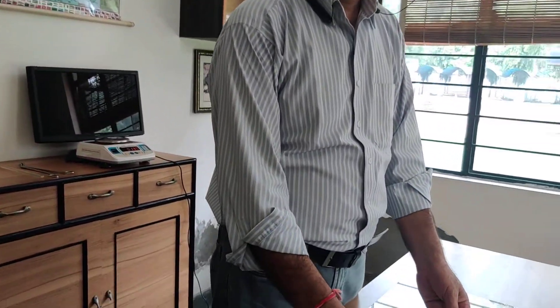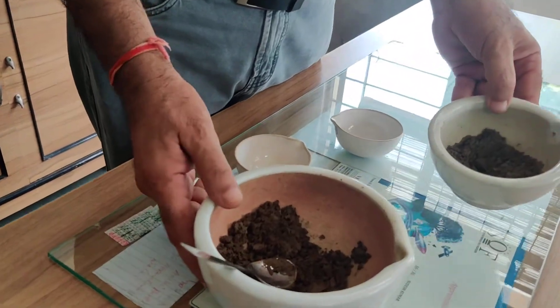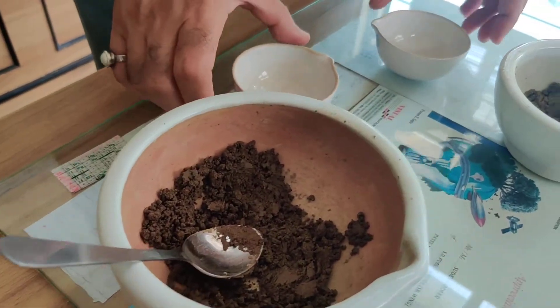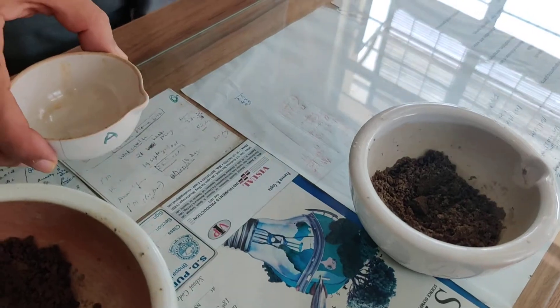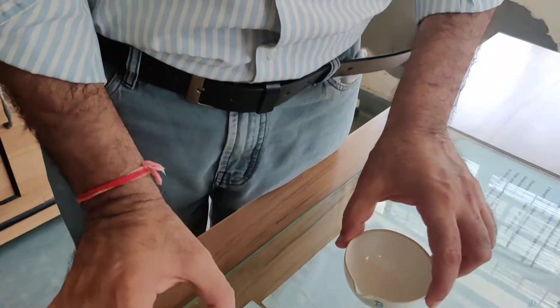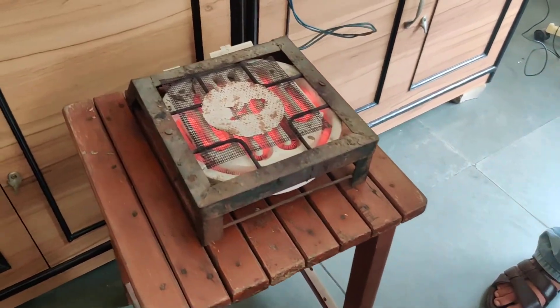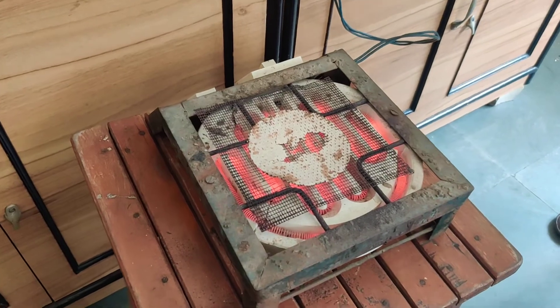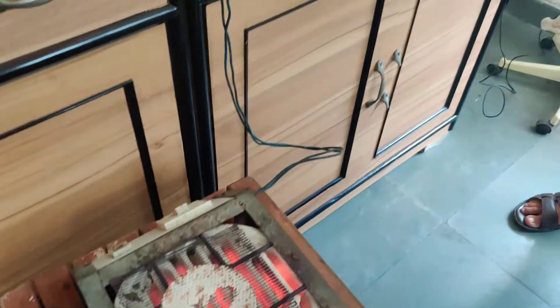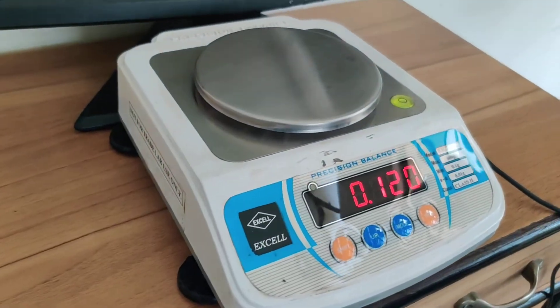For the estimation of water content of the soil, here we have two samples of the soil — sample A and sample B. We have two crucibles, one for sample B and one for sample A. We have an electric heater to make the soil dry, and this is the balance to take the weight.